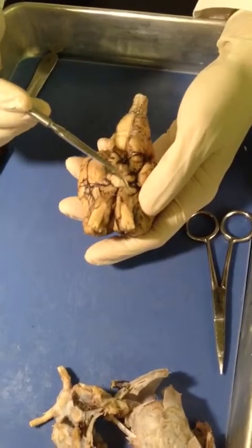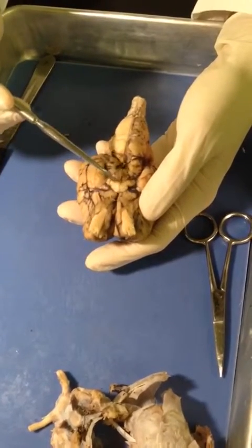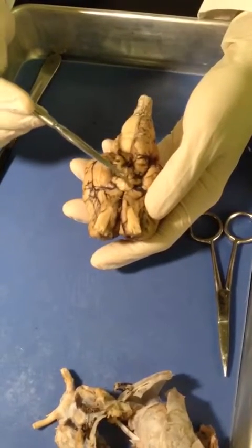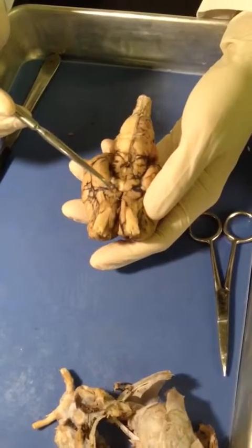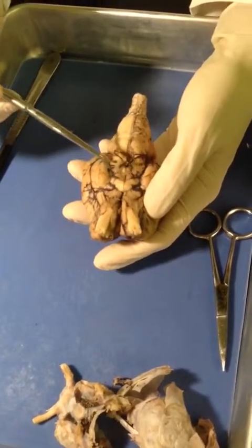The optic nerves would be coming down just like this into the optic chiasm, which is this X, and the optic chiasm was what was cut in half here. And then you have the X going like that, and on the other side is the optic tract.